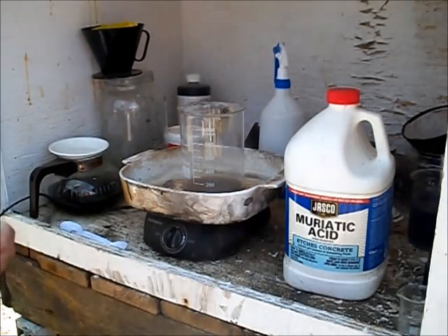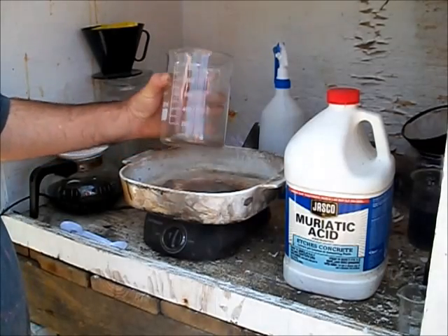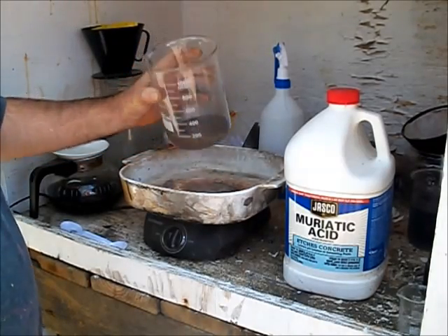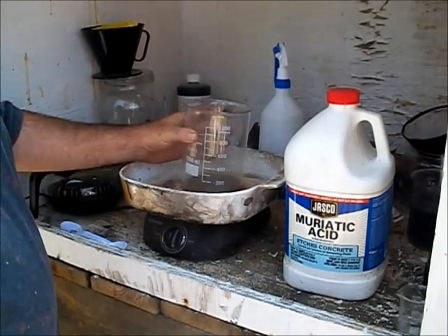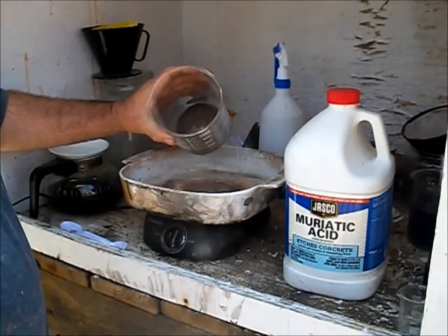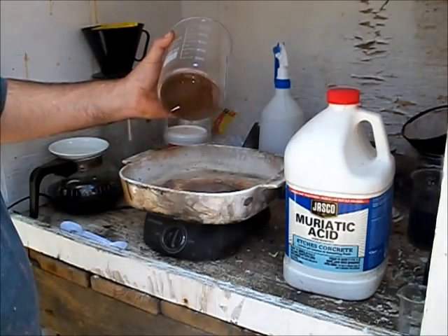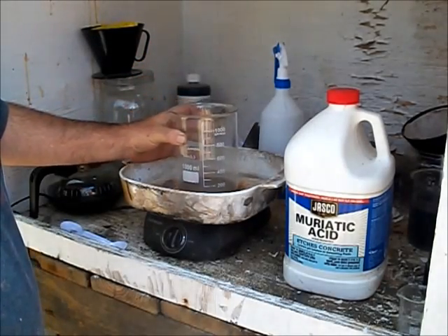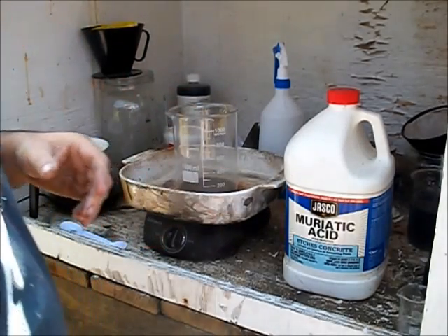I'm back. I've taken the powder from the foils and added the powder from a batch of ICs that was in the same lot, so now it's all in one beaker. It's got to be cleaned and I'm going to refine it again, so we're going to walk through this process one more time.